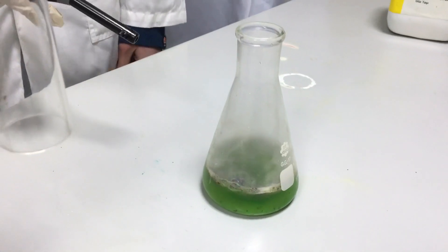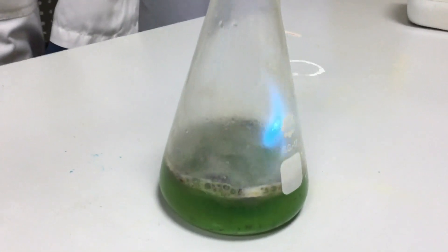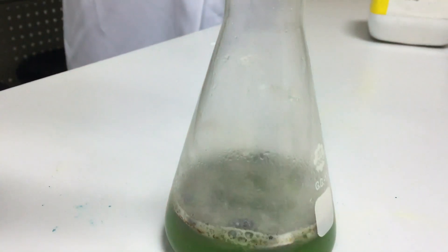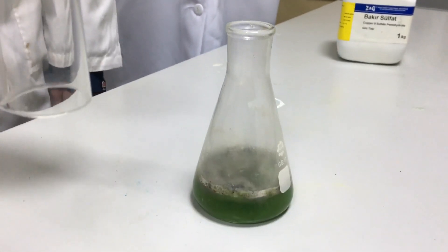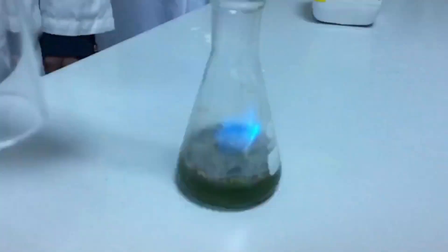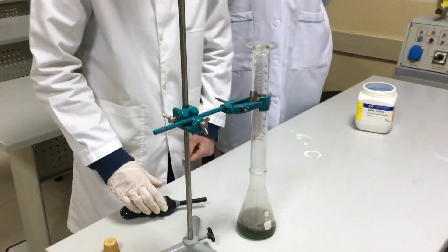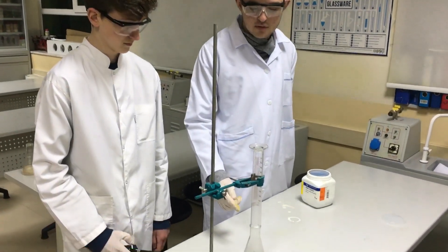We can see the burning of copper chloride. Now we are going to collect hydrogen. Hydrogen reacts vigorously with oxygen.